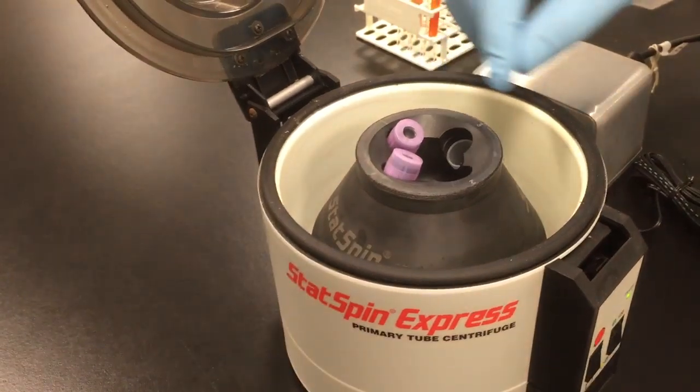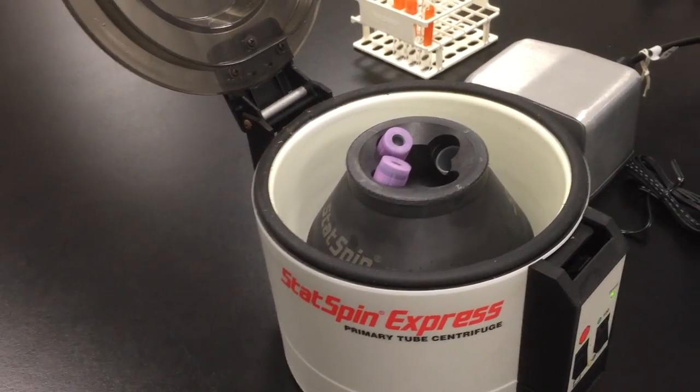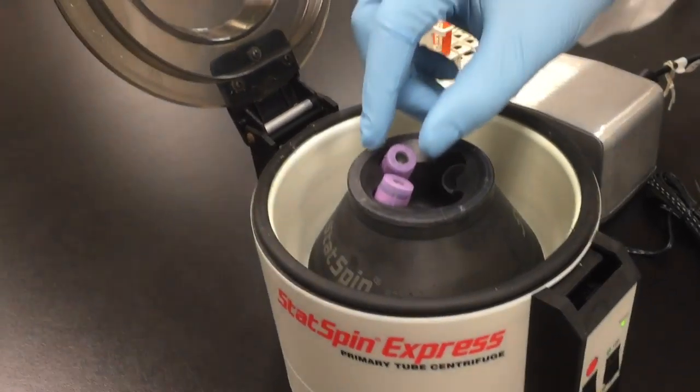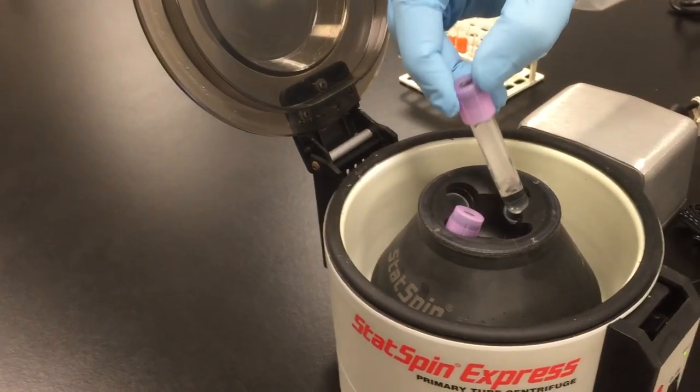It could cause the test tubes to either break or release a form of aerosol from the tube itself, which would make the testing inconclusive. You would have to draw the blood again and do the test again.